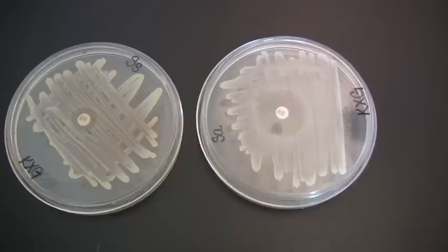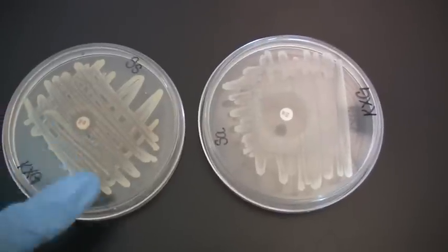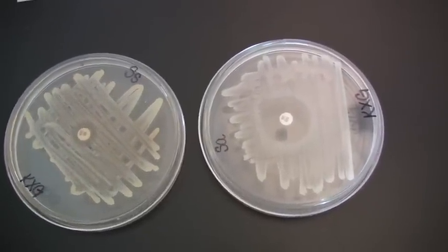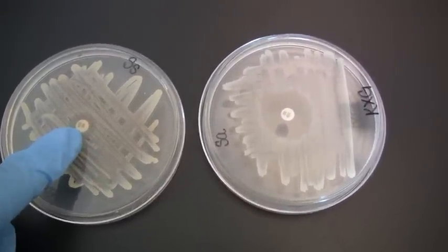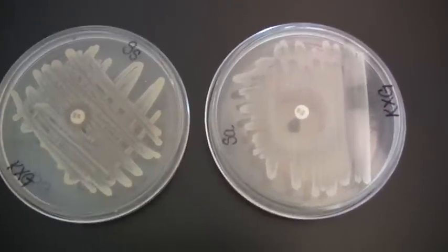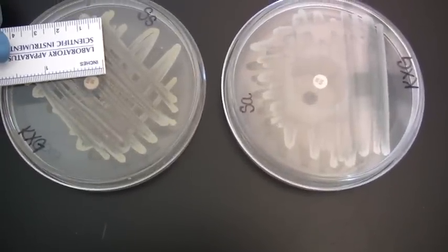In order for the organism to be considered antibiotic resistant, first we must make sure that a lawn has been inoculated, and that's simply where we've gone over with the cotton swab repetitively, often in two directions, so that we can get a nice coating of the organism on the plate. Once the antibiotic disc was deposited with sterile forceps, then incubation occurs, and then we look to see what we call the zone of clearing, or if the zone of clearing exists. In this particular test, you want to see an inhibition of growth at least 16 millimeters away from the disc.